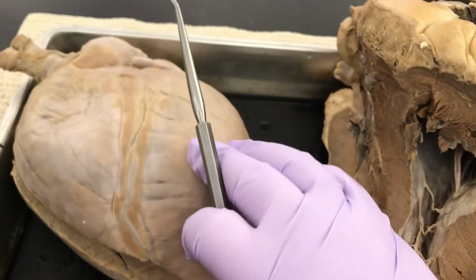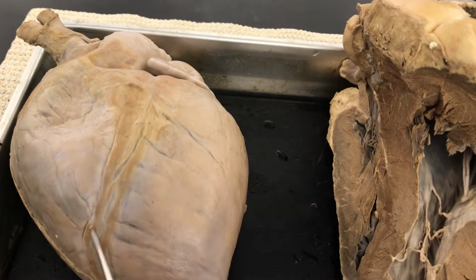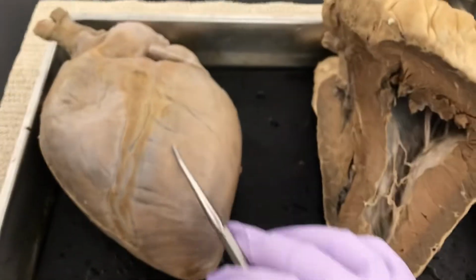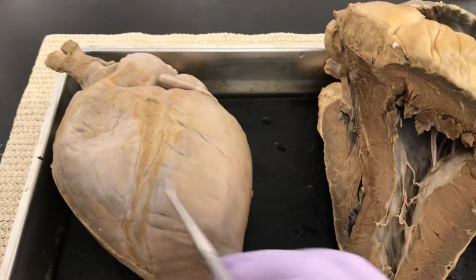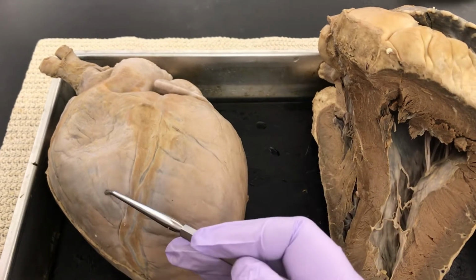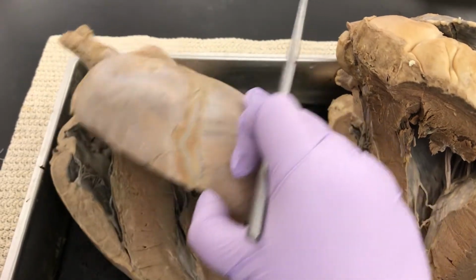Look, they lie right on top of each other. So that septum causes a little groove to form here. Meaning all of this would be the left side of the heart. Remember, your left side of the heart is the bigger side. This side would be the right side. So this would be where you'd see the right ventricle. It's the open space inside.